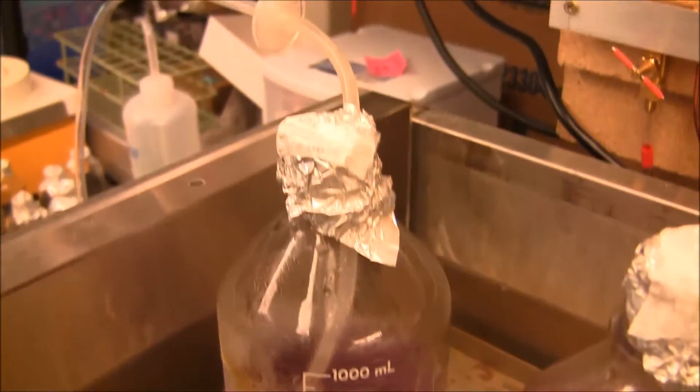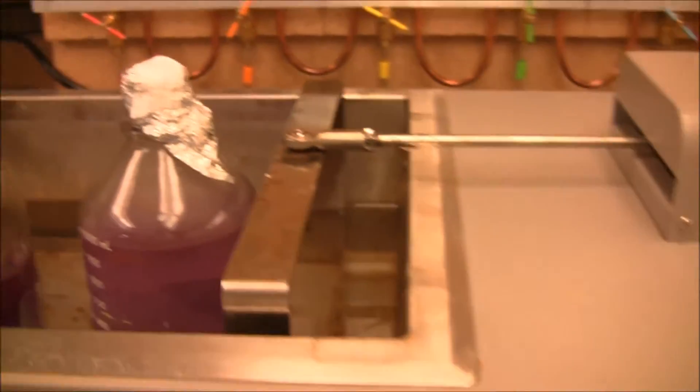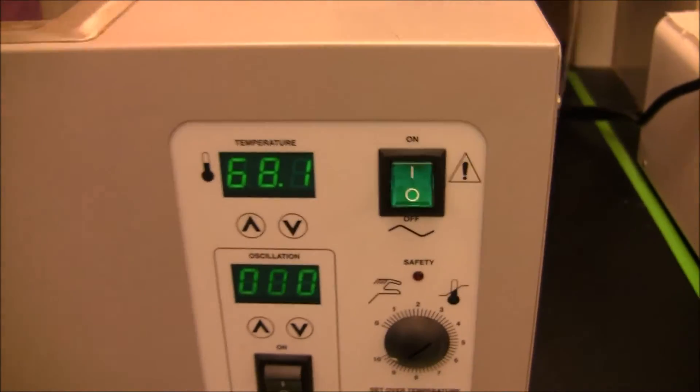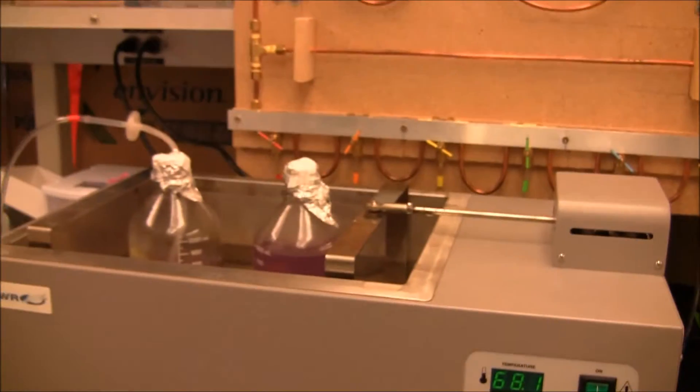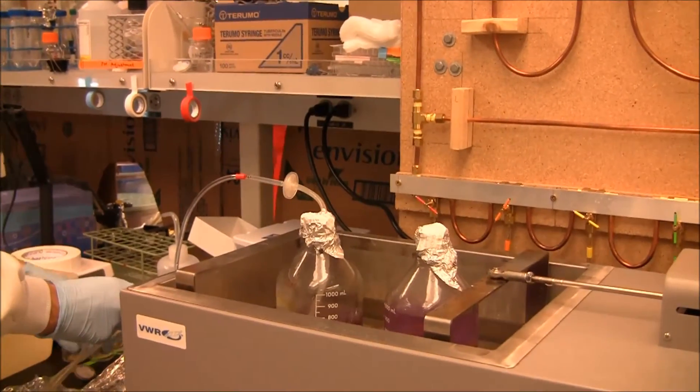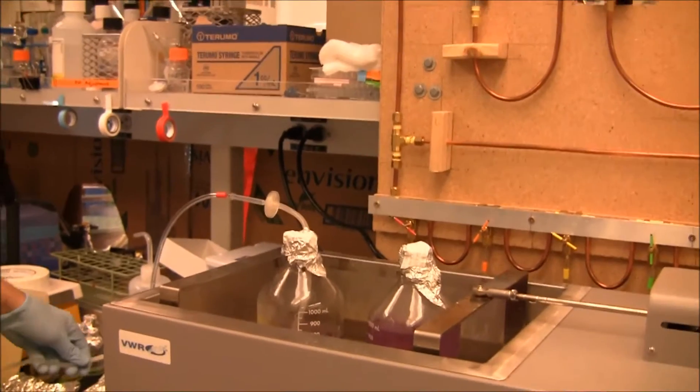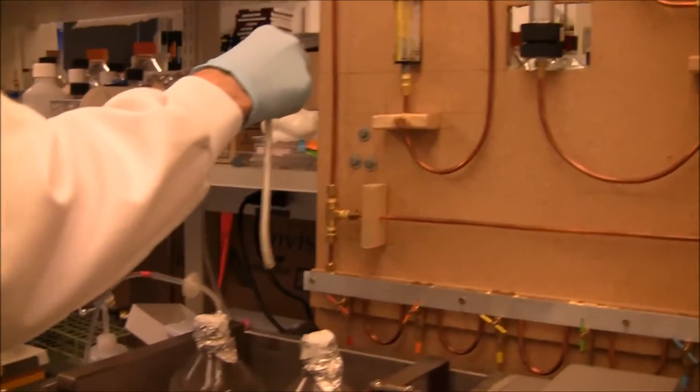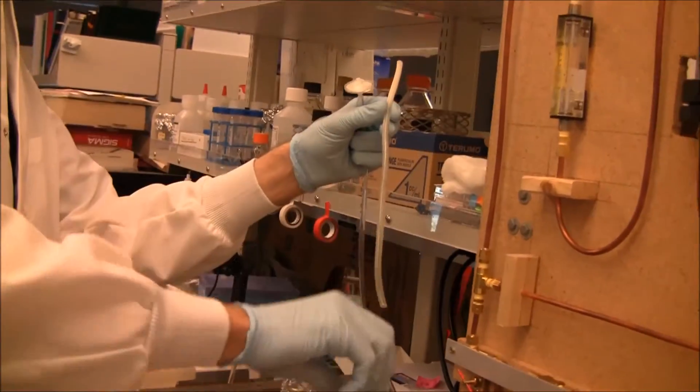And then wrapped around the top, like this. It's very easy to do. I'll do the same thing over here.